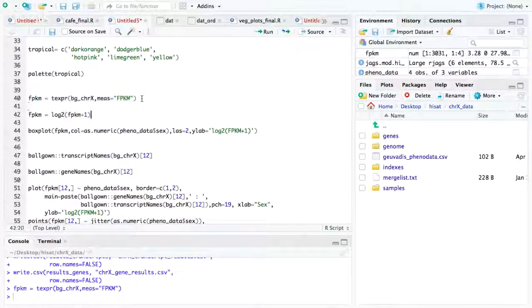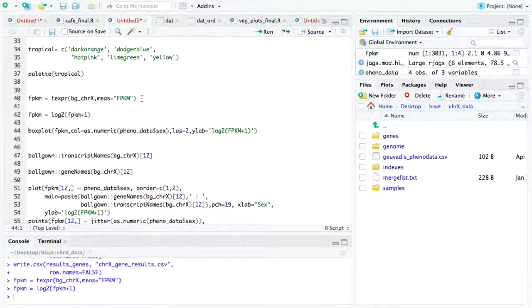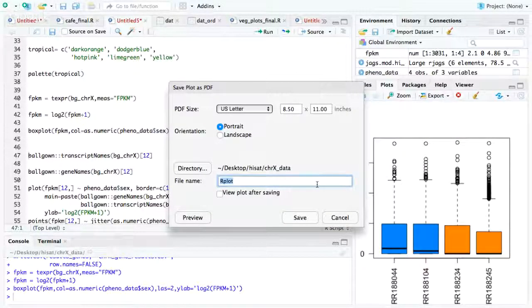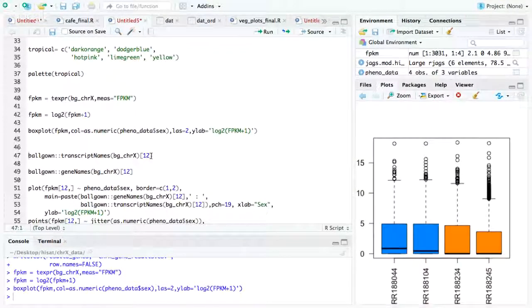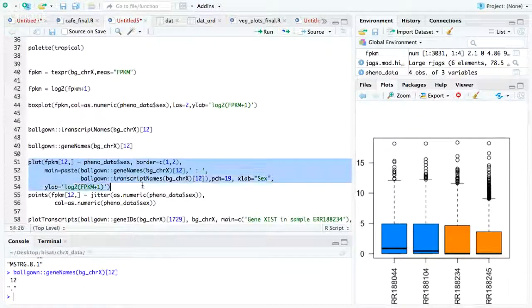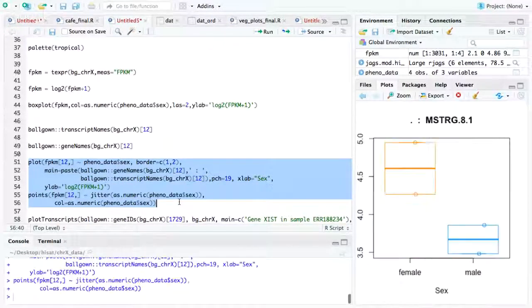So setting up the dimensions, box plot. Oh, there it is. And the plot here is showing the difference in expression between the male and female subjects in the study.